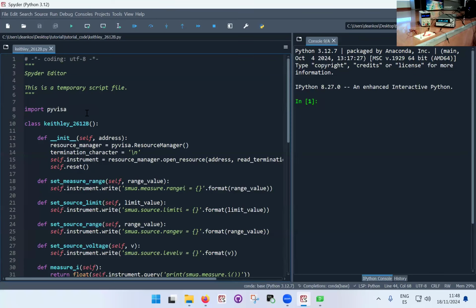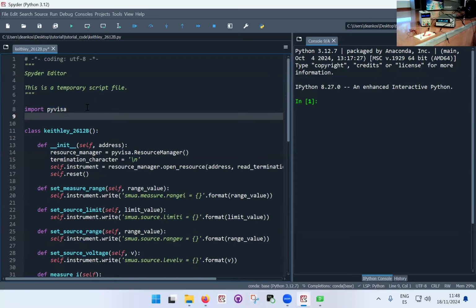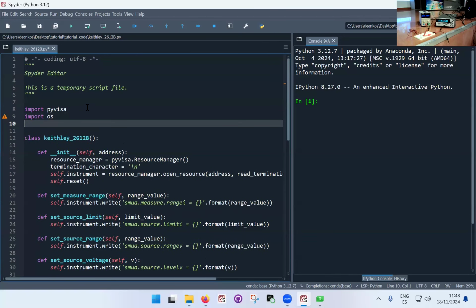Okay, so to do that, we're going to need the so-called PyQt package. And so this is what I'm going to do now. I'm just going to import a few things which I'm going to use later. It will make sense a little bit later. So I'm going to import OS, which is a package to manage things related to the operating system. In my particular case, I'm just going to use it later to get to the directory of the file that I'm trying to open, the user interface file.